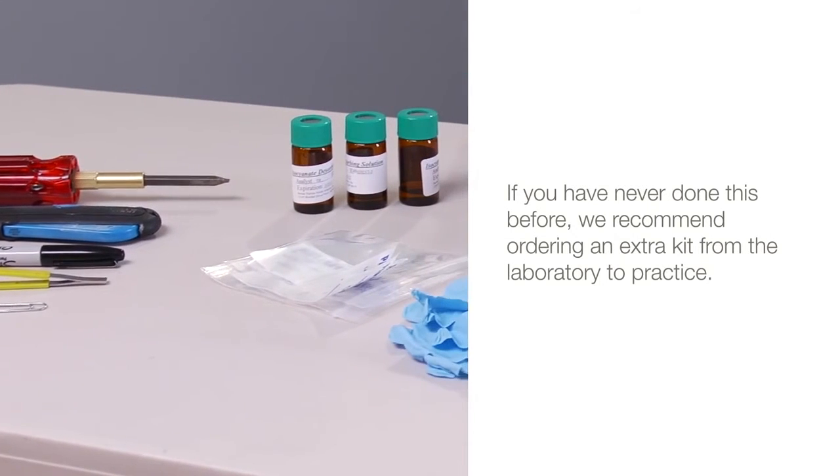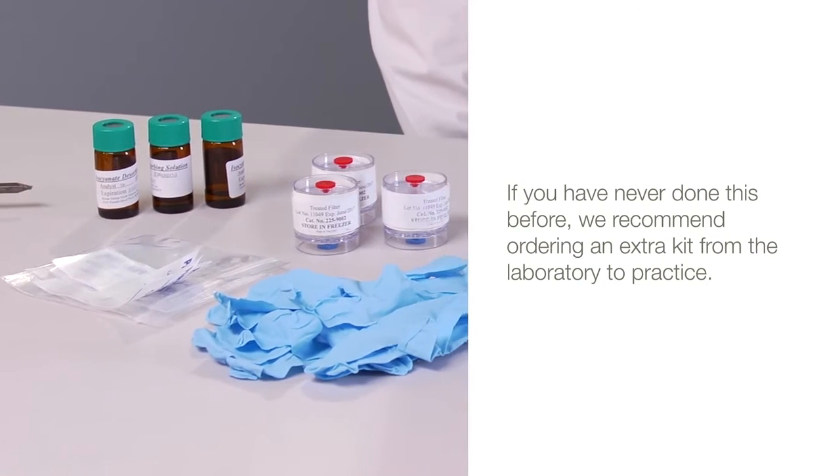If you have never done this before, we recommend ordering an extra kit from the laboratory to practice.